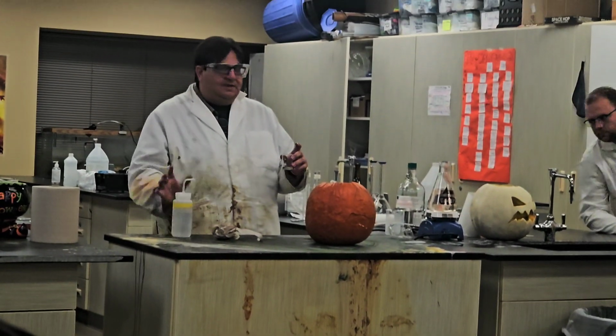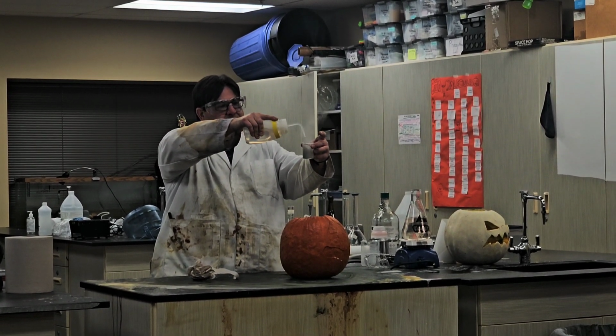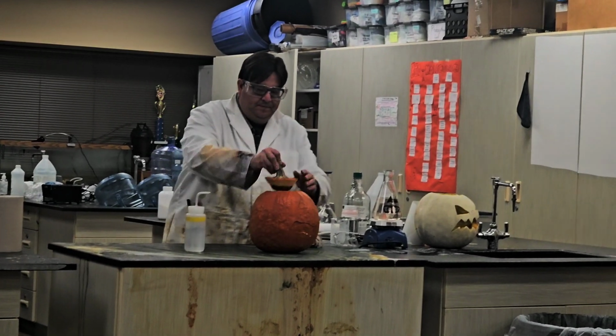Acetylene is flammable, it's the same thing as in an acetylene torch. So if I add a lot of water to this, I can have a lot of acetylene gas in here. Nice. Happy Halloween, everyone.